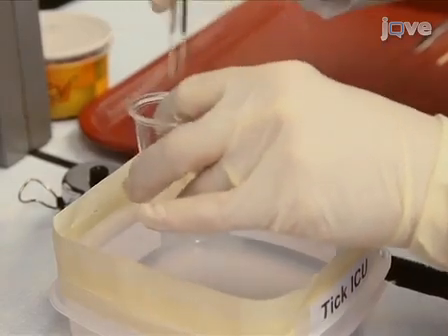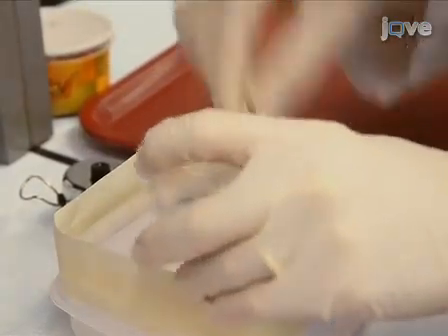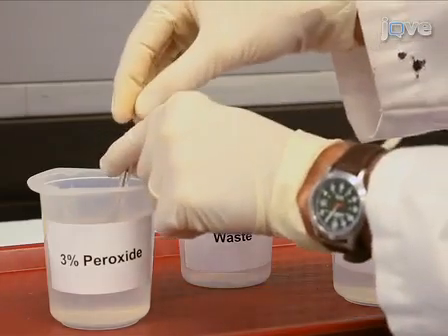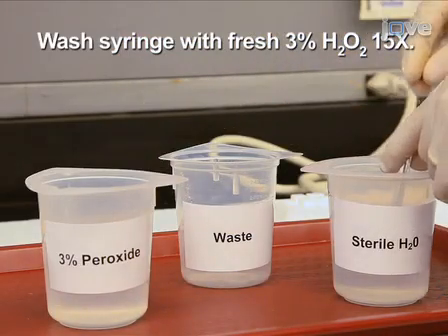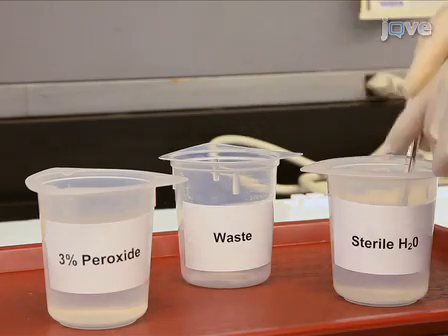Count the ticks in each experimental group and place each group in a labeled plastic cup with a tightly fitted lid. Replace any ticks that die in the current group before injecting the next experimental group. Clean the Hamilton syringe before injecting the next experimental group by filling and then expelling the syringe with fresh 3% hydrogen peroxide 15 times, followed by 15 washes with sterile water.